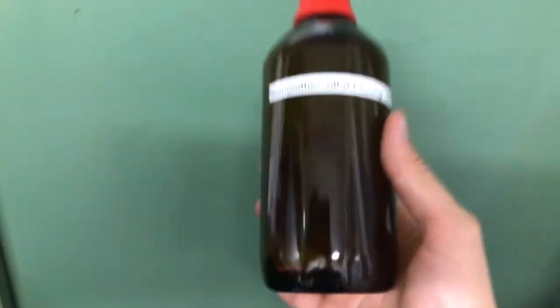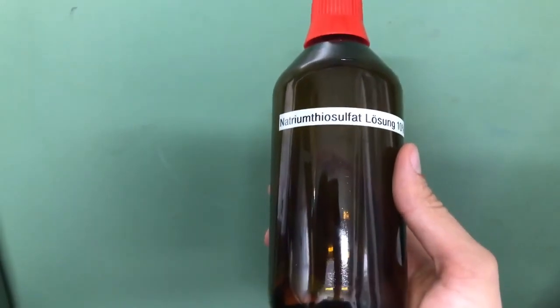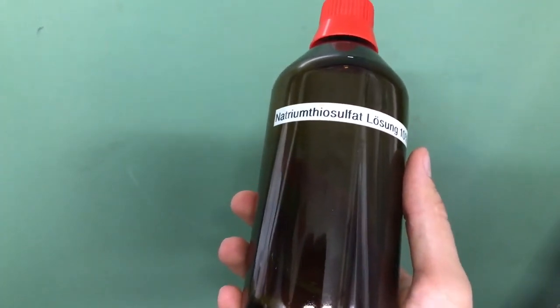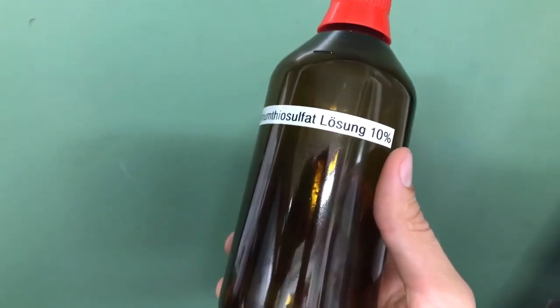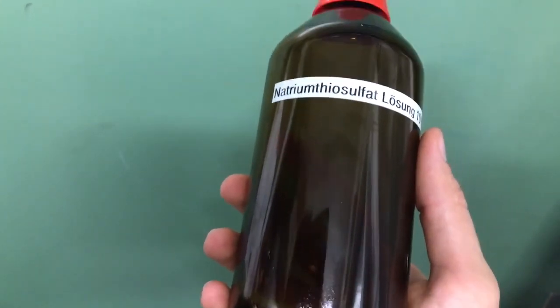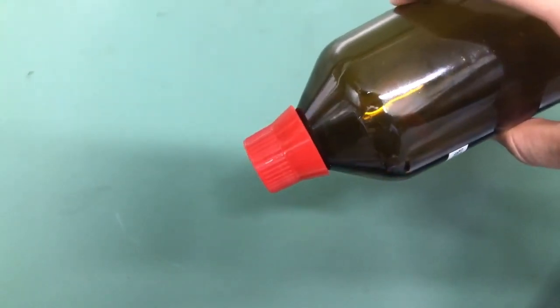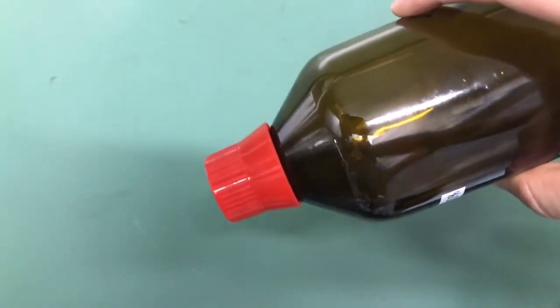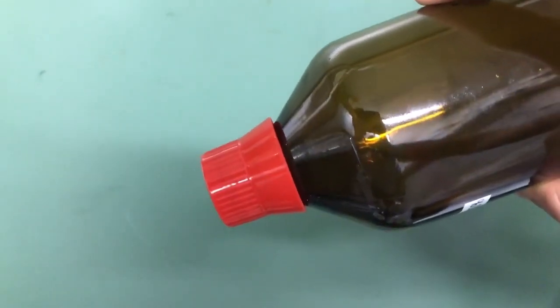Normally, a solution of sodium thiosulfate would be used to neutralize bromine spills. But I believe this is only suitable if you are cleaning an apparatus and you have to get rid of bromine, but not if you spill a large amount of bromine on the table, because if you pour this stuff onto the table, it will flow off without neutralizing all of the bromine, because it is a liquid and it will flow off the table.